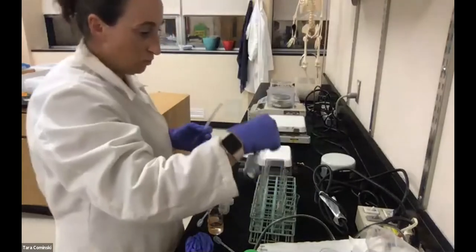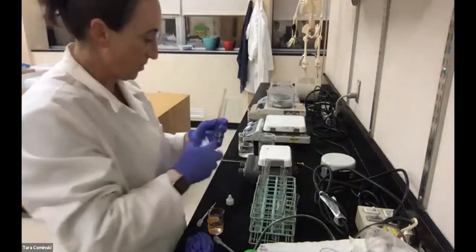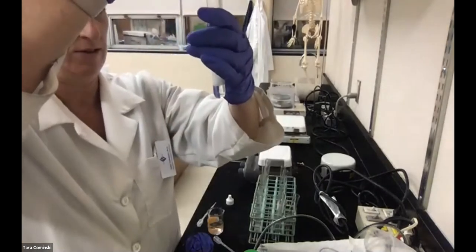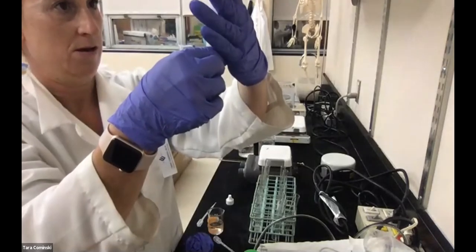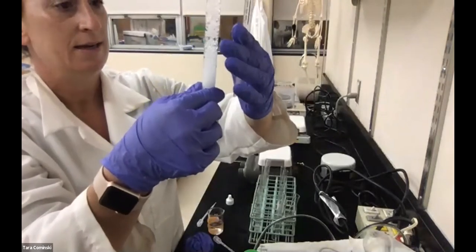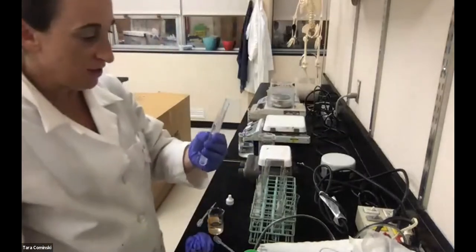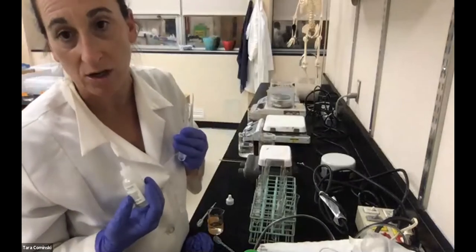Okay, tube 2, we're going to add 1 milliliter of catalase to it. So we'll get ready to measure here. All right, so I'm gonna call it 100 millimeters for the bubble column height. 100 millimeters for tube 2, which had 1 milliliter of enzyme.